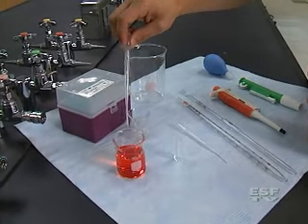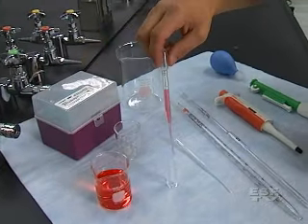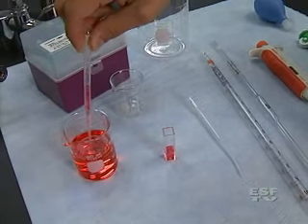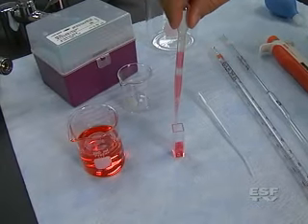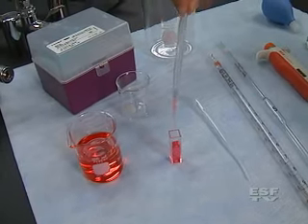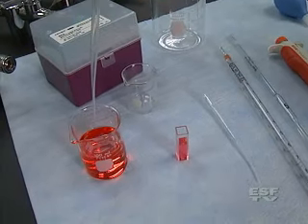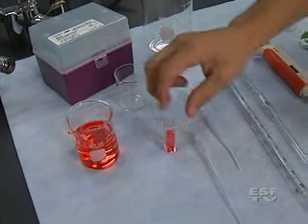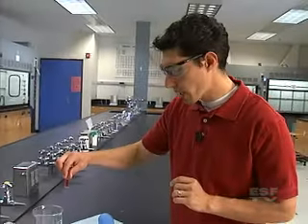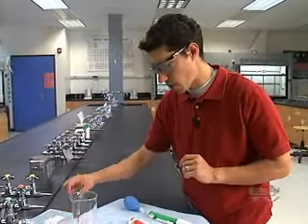I'm going to withdraw some solution by pressing the bulb and solution will pull up through the pipette, and then I can fill my cuvette and put it in my Spec 20, which you may have seen in our Spec 20 segment. Now I have my cuvette filled and I'm ready to go. That's the main purpose for a transfer pipette, but you may use it for some other purposes in lab as well.